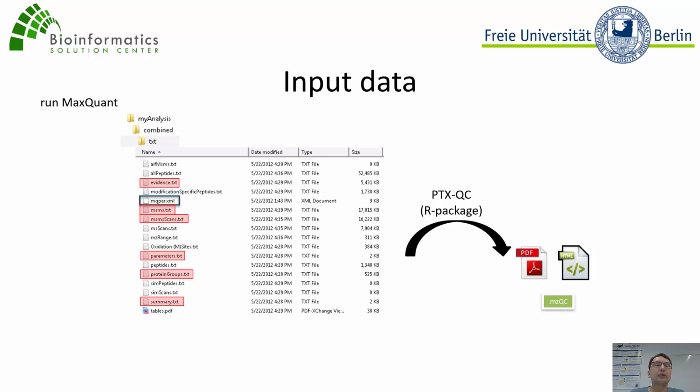In some cases, you do not have access to the full txt output of MaxQuant, but only partial data. For example, if you downloaded partial data from the internet. If some of those files are not present, it's no problem. It just means that the metrics which are derived from those files cannot be computed. The most important file at the moment is evidence.txt. This is where most of the metrics are derived from. So if you have that, you get a pretty comprehensive report already.